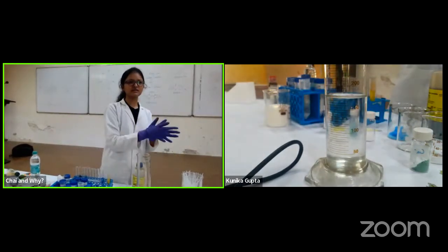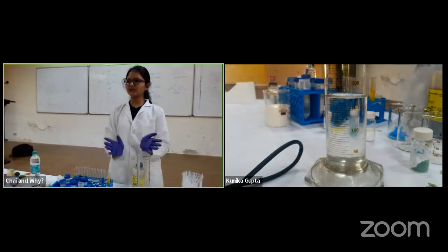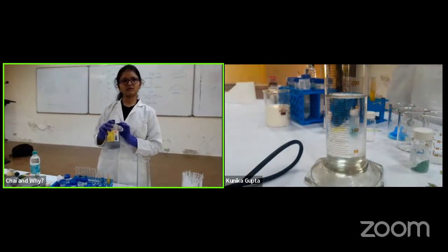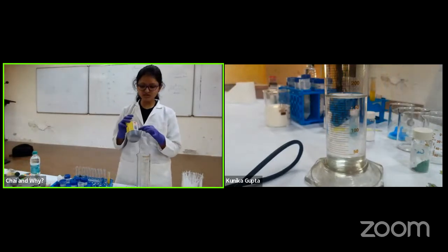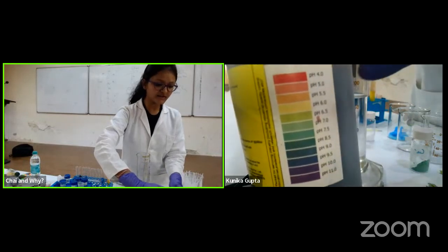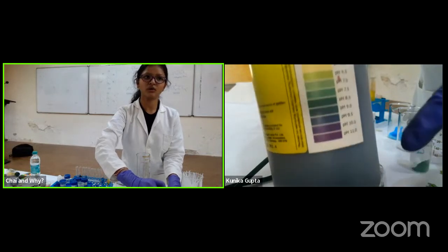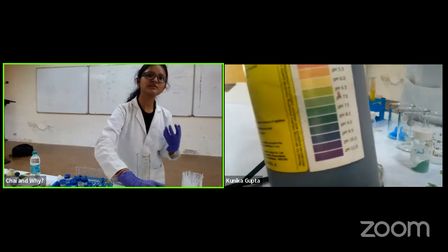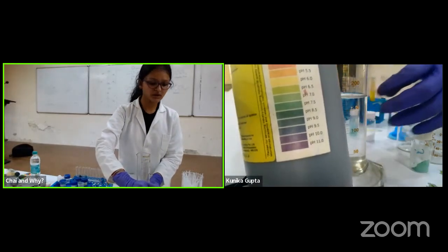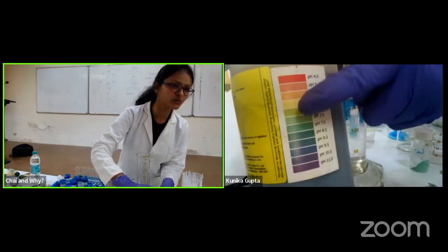If there is an acid, there is a base. Acid will donate protons, base will take the protons. Some amount will remain. What remains, that will be told to me by an indicator. How will the indicator tell me? In a balance sheet I see a number. Here also you see a pH scale. I'll show you in the camera that there's a pH scale. There are different colors corresponding to that, which will tell me what pH we are actually on. pH is actually a logarithmic scale of the number of proton ions that we have in the solution. Okay, so it's visible, right? That there is a pH corresponding to a color.